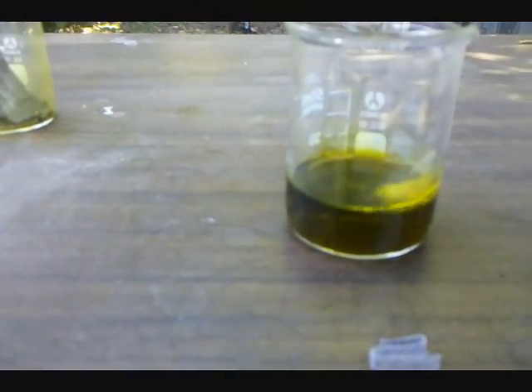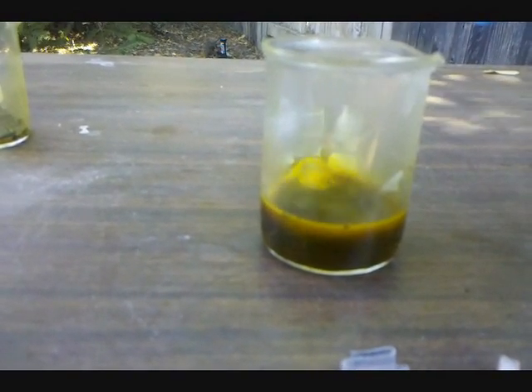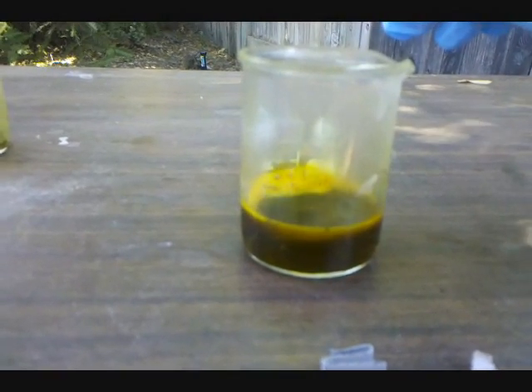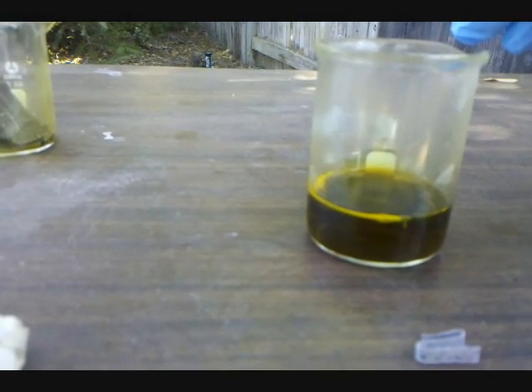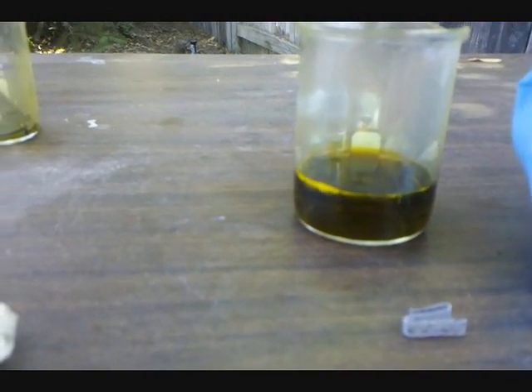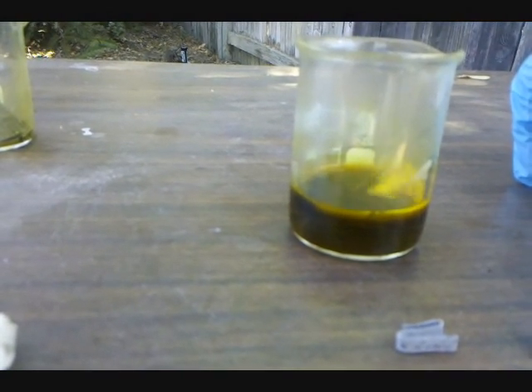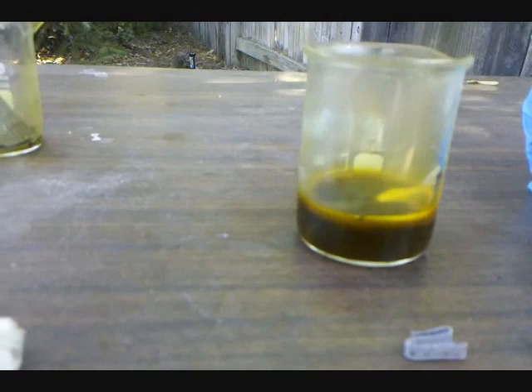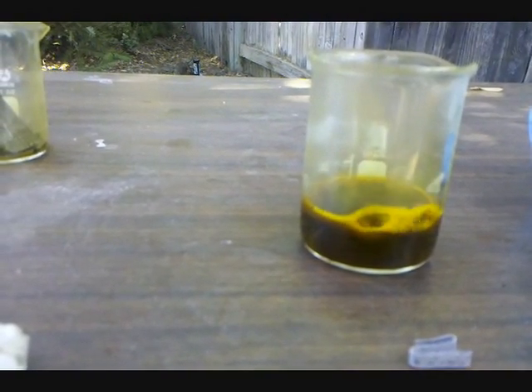I've got some magnesium from magnesium ribbon and I'm dropping it into the solution. At first it reacts really rapidly because there's leftover nitric acid and hydrochloric acid, which dissolves magnesium very quickly. You might want to be careful because some nitrogen dioxide gas will be produced. After all the nitric acid and hydrochloric acid is consumed, the chloro-auric acid will start to work on the magnesium.